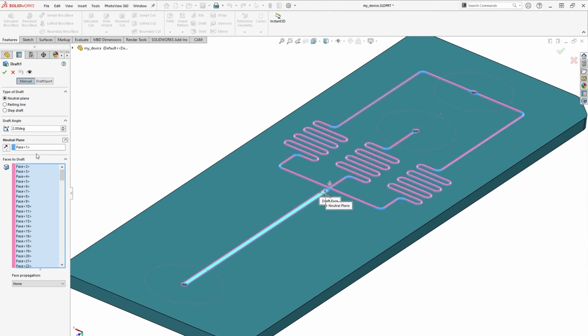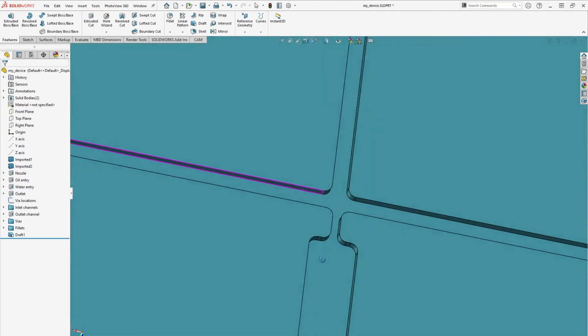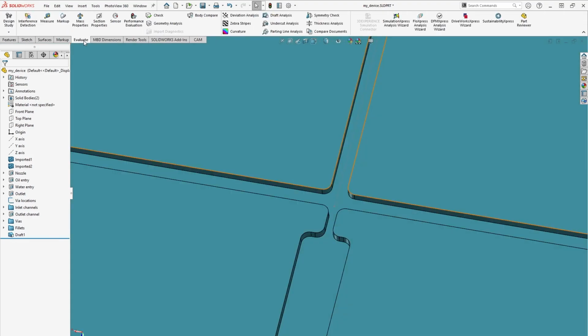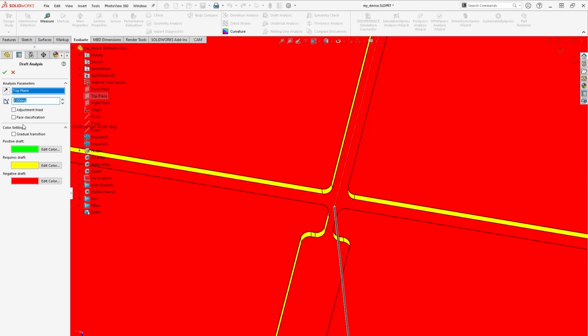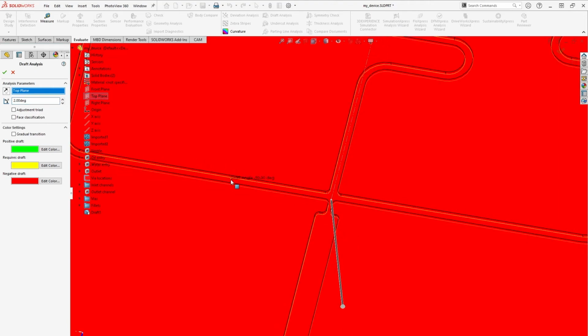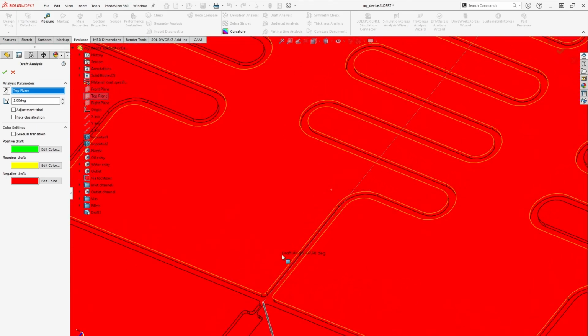Alright, fluidic layer work should be done. It's worth a quick check to make sure all of the corners were filleted and the draft worked correctly. A great tool that Solidworks has in the Evaluate tab is called Draft Analysis. If you select the surface of the device and adjust the angle to 2 degrees, it will color code the surfaces, showing you which have at least 2 degrees of draft. This really helps to verify that all of your microfeatures are drafted appropriately. Since the vias and sidewalls will be post-machined in this case, it's preferred to leave them undrafted in our process.